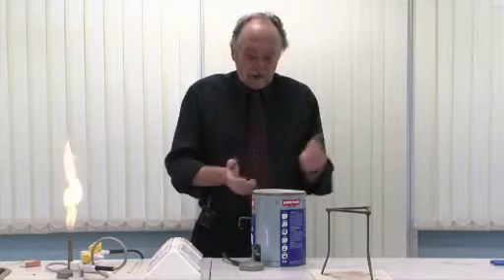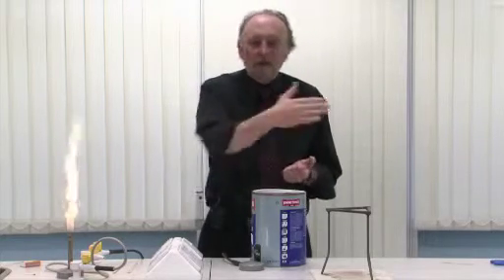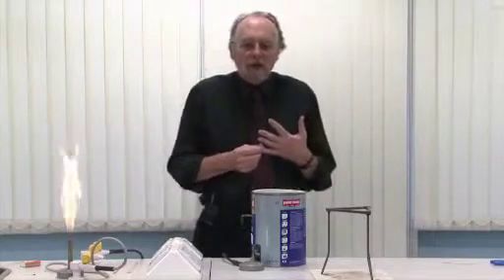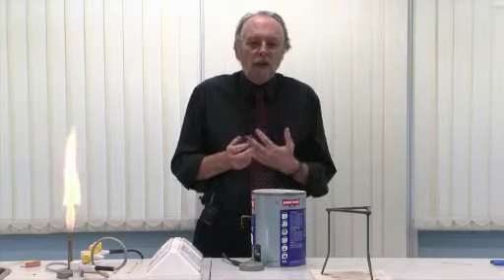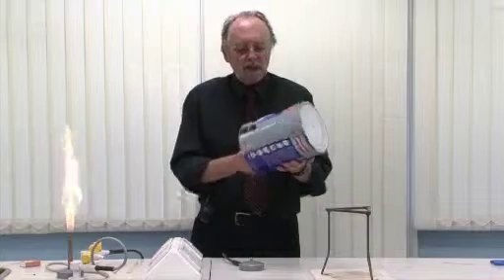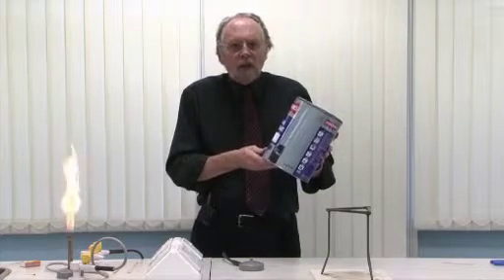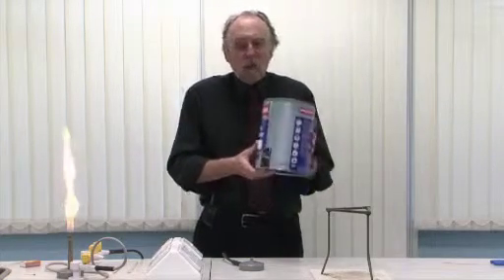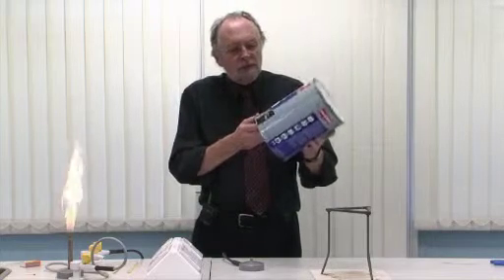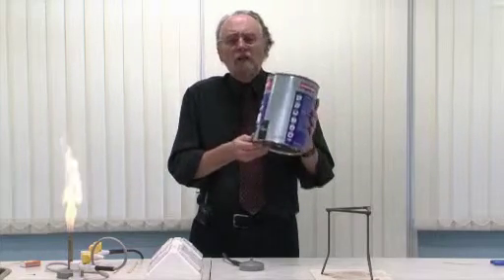When we get the explosion, the lid will fly off — up into the air with some violence. But again, it's going directly up. If I were doing this in a school, I'd probably put a safety screen in front of the whole apparatus. The only things in here are video cameras at a good distance. There's a great deal more gas this time, and you will be surprised just how long it takes to reach the critical mixture — which is around 10% methane to 90% air. This is a fairly reproducible result, and in the past it's come out at around 11 minutes.